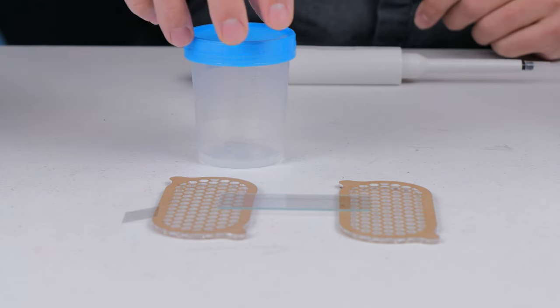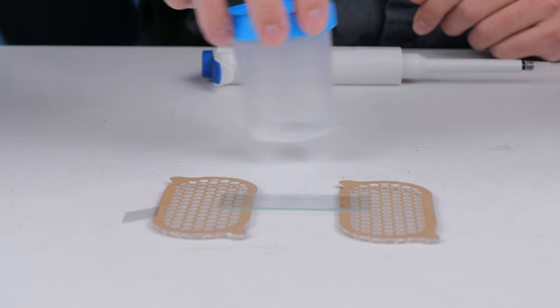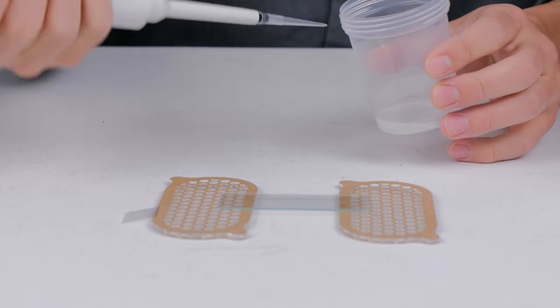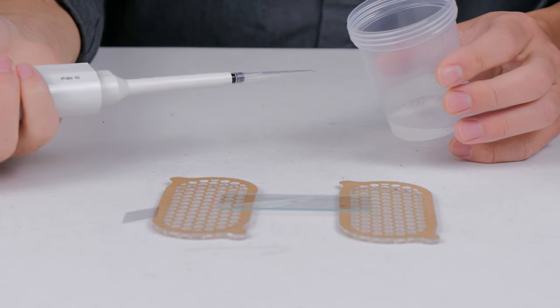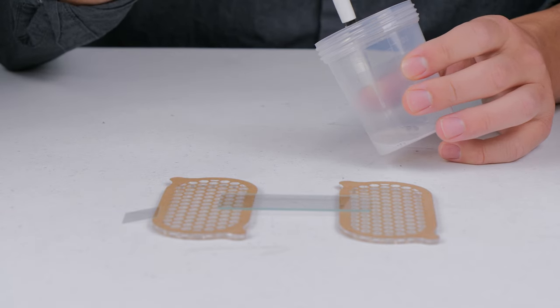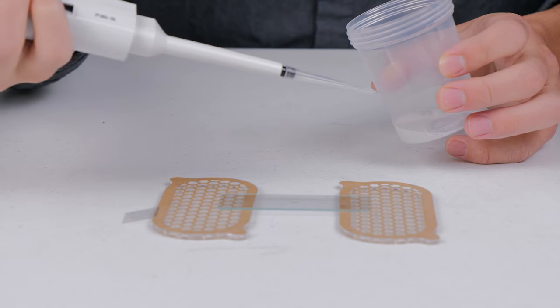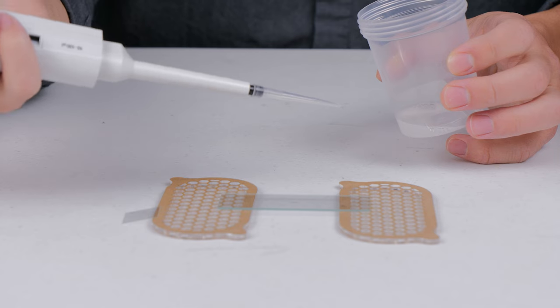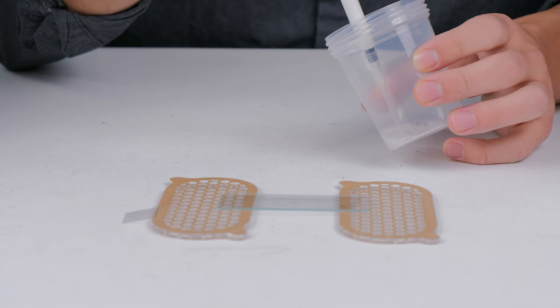Now make sure that every time before you take a sample out of your collection jar, you do a re-swirling ideally for 30 seconds. Do that now. Next, right after swirling, you're going to want to collect approximately 10 microliters of your sample and put it on the microscope slide. I'm using a micropipette here, but you can also just get away with using a plastic dropper. 10 microliters is approximately like a fifth of a drop of water, so it's a very small amount.